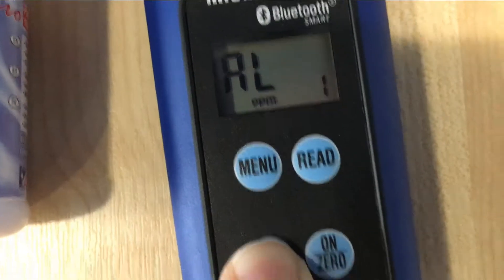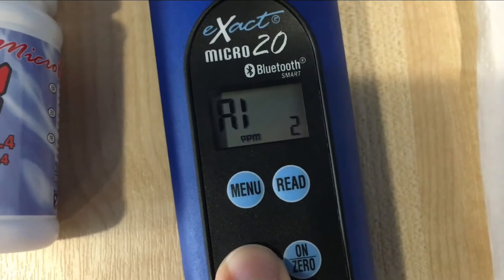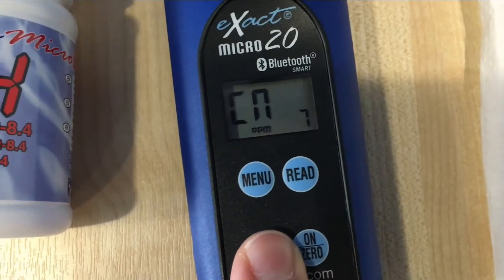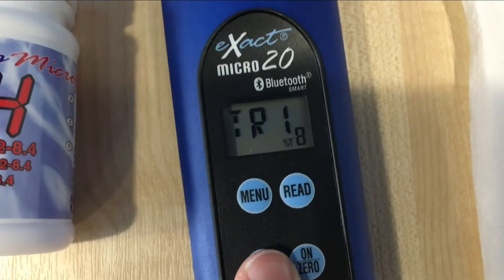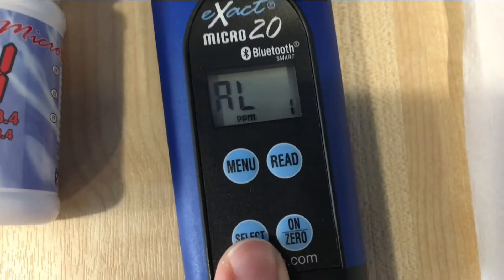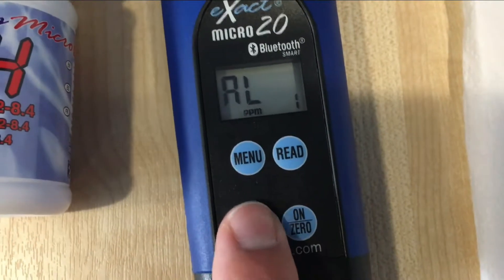The select menu is 1 in the corner. We change through 1, 2, 3 and cycle through the large menu until we get to 1. If we need something else, this is how you change it with select.